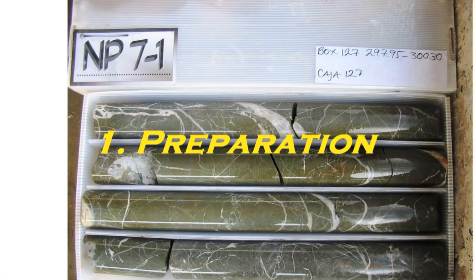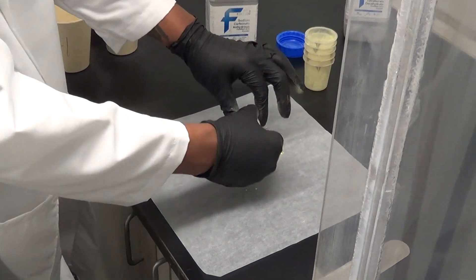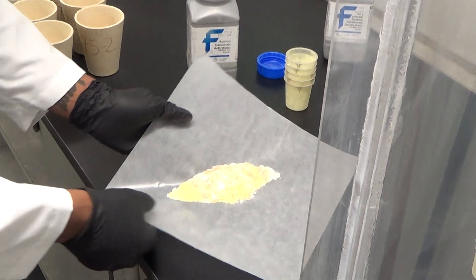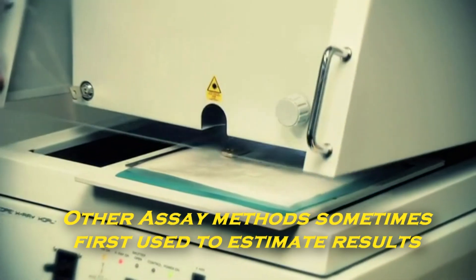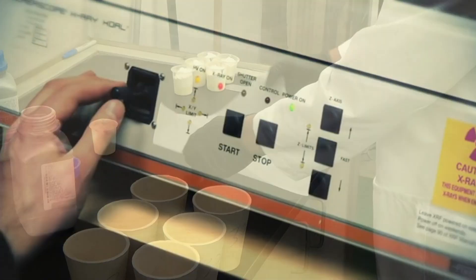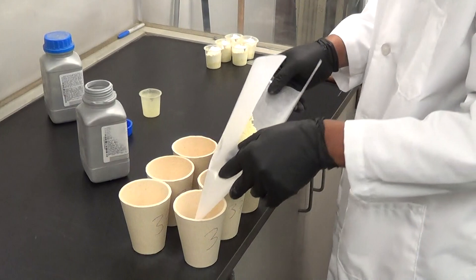Sample preparation is generally first done by grinding or milling samples into a fine powder, so that the sample can be thoroughly mixed with dry powder chemicals used in the next step. Initial samples are sometimes evaluated by another method, such as XRF, to provide a rough indication of the composition to help determine the amount of reactant chemicals to add. The precisely weighed sample and dry reactant chemicals are then thoroughly mixed together.